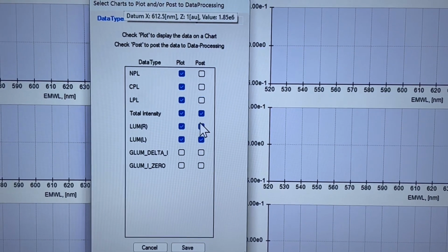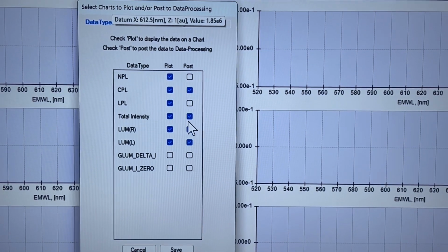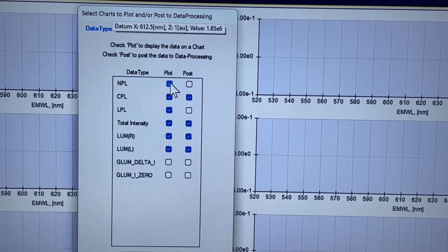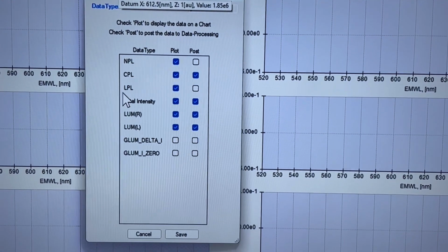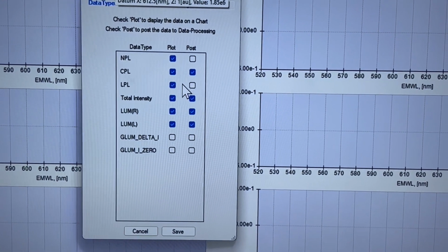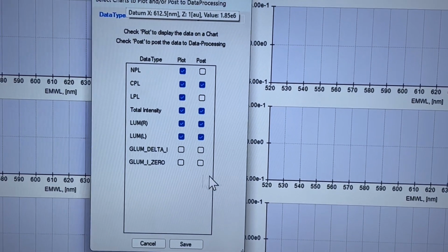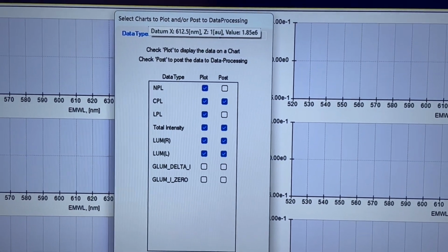Yeah, exactly correct. Now, let's say we do this, and I want to see the intensity, but I know there's no meaningful information, it doesn't tell me much. And the linear polarization it will not post. So plotting lets you watch it while it's being collected, but you're not anticipating that it's going to be interesting enough to save. Correct, exactly, well said.